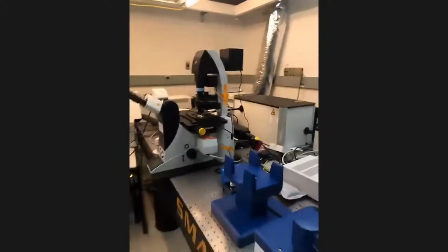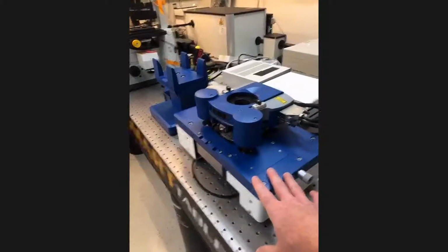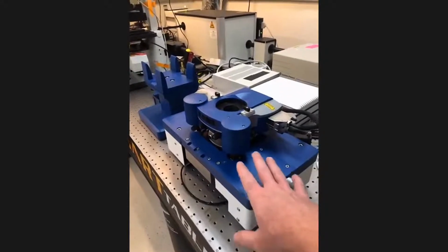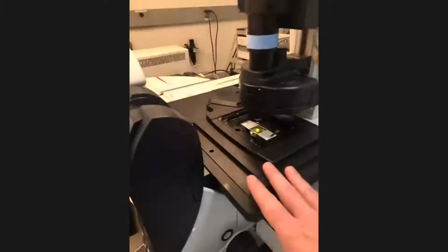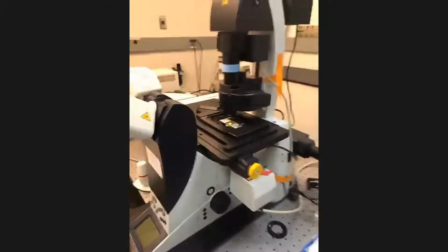And then the last thing, just because we won't have time, I'll just mention, is that this here is actually an atomic force microscope that does mount. If we move it, it actually does mount right on here. Now, we didn't have time to do it for today, but this allows us to do simultaneous optics and atomic force microscopy, these scanning probe measurements, where we can see how physical structures respond to force, right? If you push on a cell or on an organism, for example.